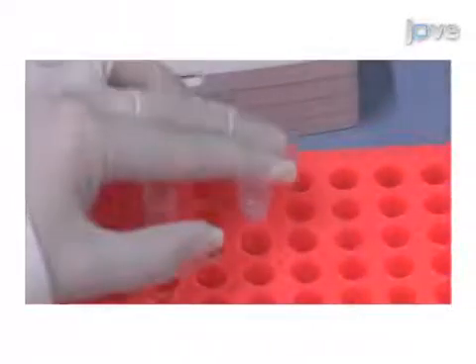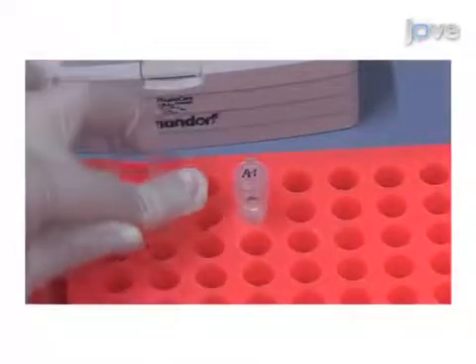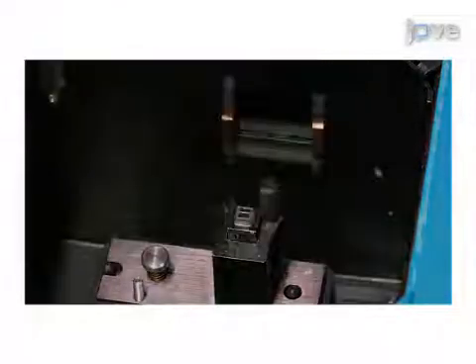The second step is to generate peptides by sample processing using multi-enzyme digestion filter-aided sample preparation. The peptides are then quantified by measuring their tryptophan fluorescence.